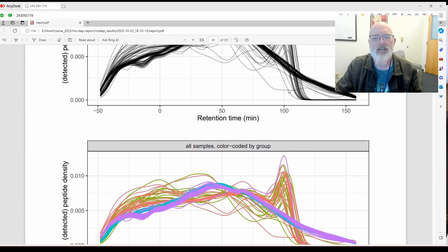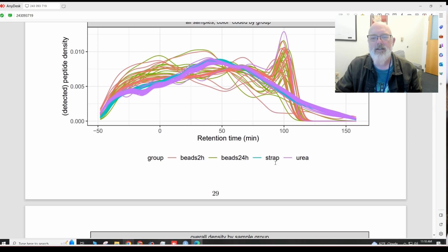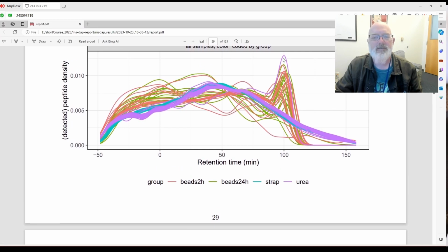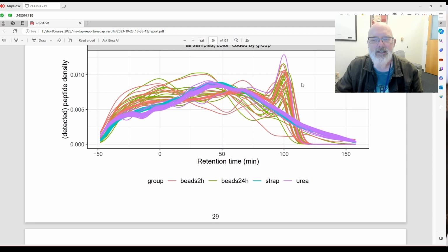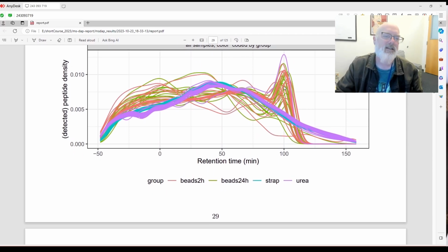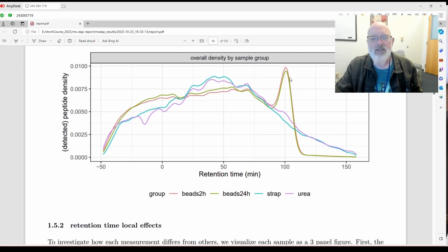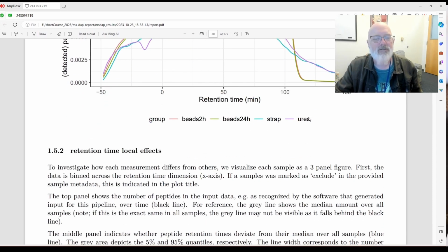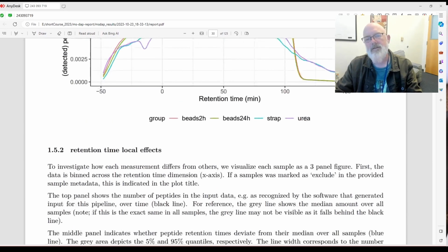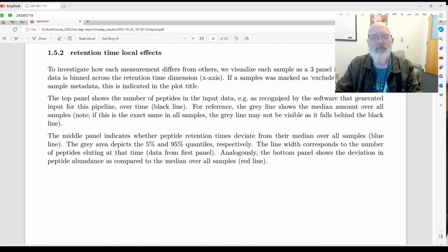You could see these are kind of weird, huh? Let's see. And what does that mean? This is urea, S-trap, beads. You can see, does this mean it has more hydrophobic? These would be the hydrophilic. These would be the hydrophobic. And you could see these beads 2 hours has some peptides that are different. I wonder why. Okay. Overall, colored by group. That's actually really cool. So it looks like the beads in 24 and 2 hours have more hydrophobic peptides than the other ones. Why would that be? I don't know. But that's kind of cool, I would think. Or maybe there was something wrong with chromatography. We'll have to go and see.